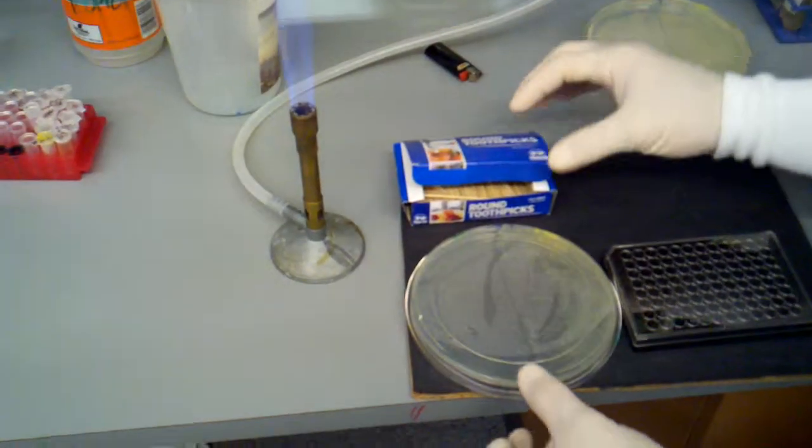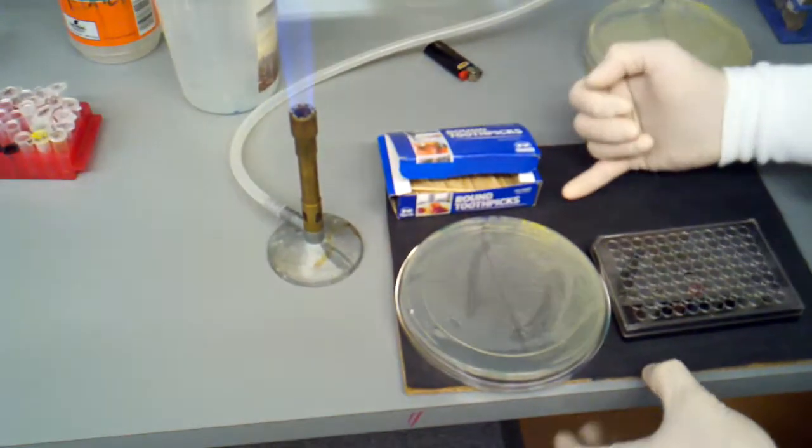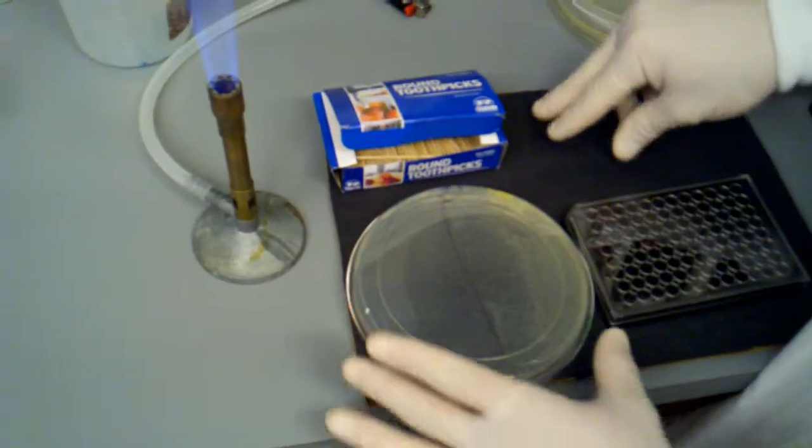As you can see, I'm doing this on a black background. This gives me good contrast between the colonies, so all these colonies are very clear.